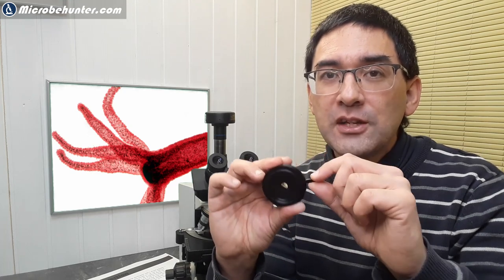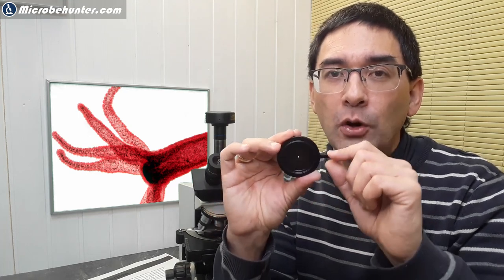Usually when focusing and when finding the focus, it's much easier to find the focus by closing it all the way first, because this way even very softly stained specimens appear at a higher contrast. The depth of field is larger, and it's easier to find the contrast and to focus.